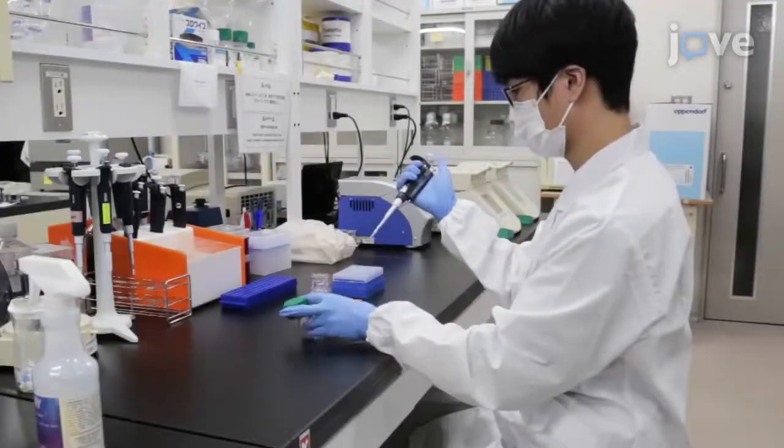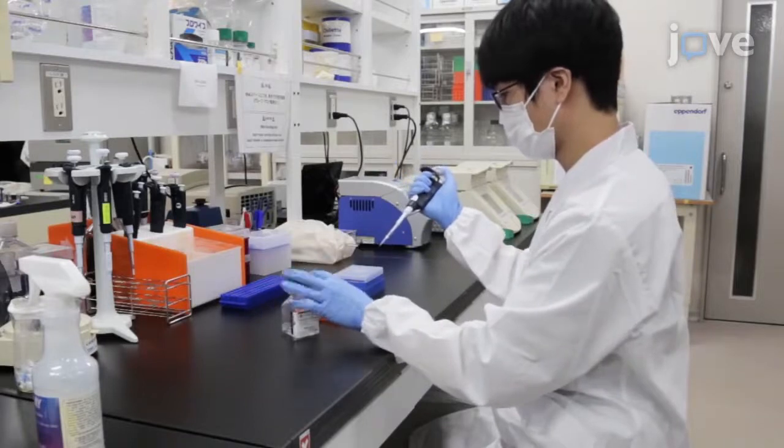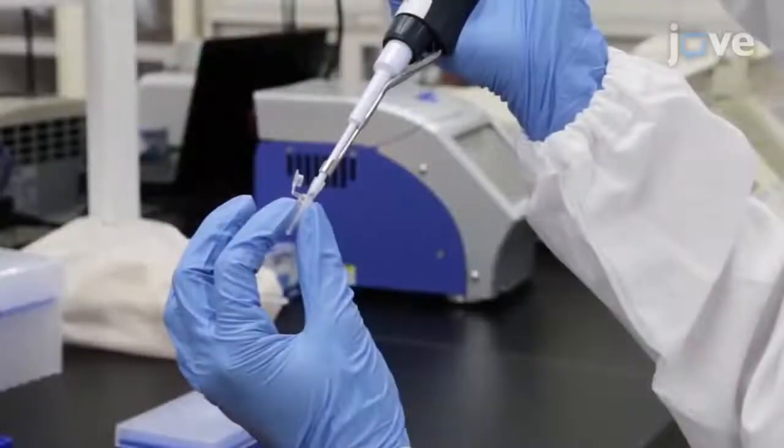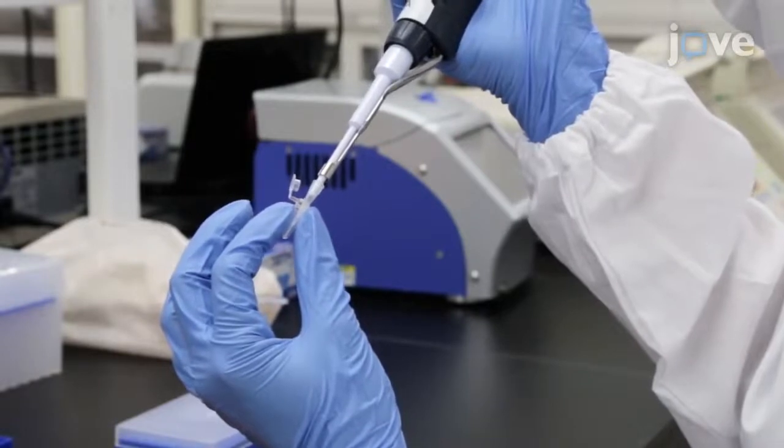After preparing EGFP-H2B RNA according to the text protocol, use nuclease-free water to dilute it to 250 nanograms per microliter.